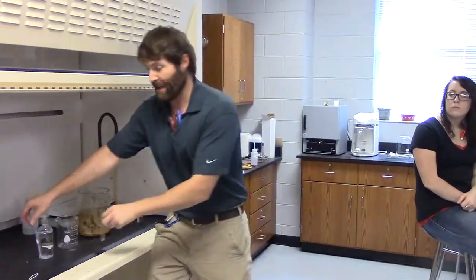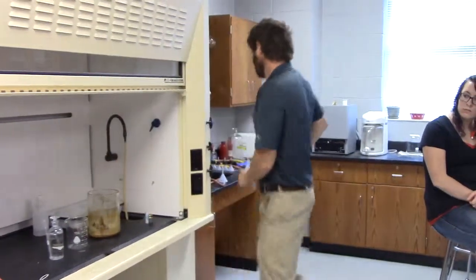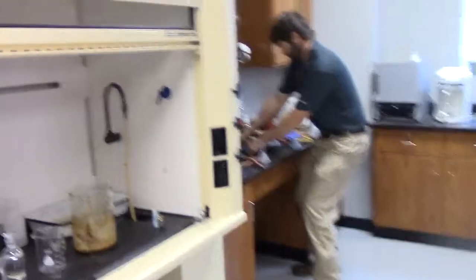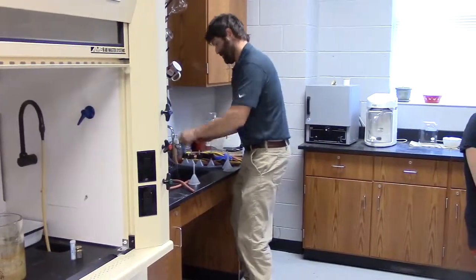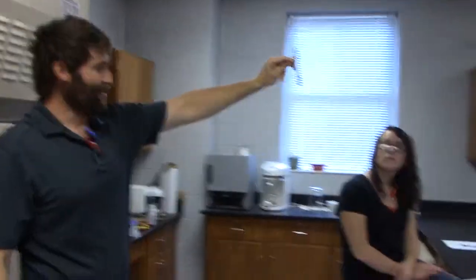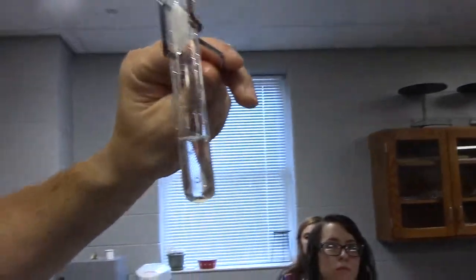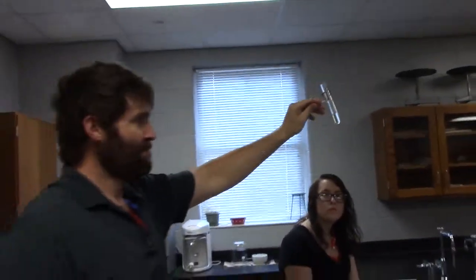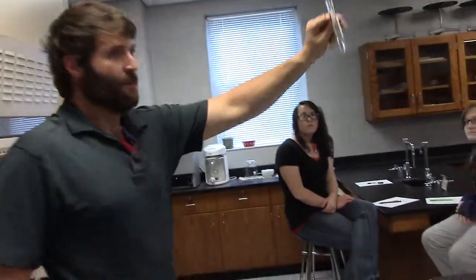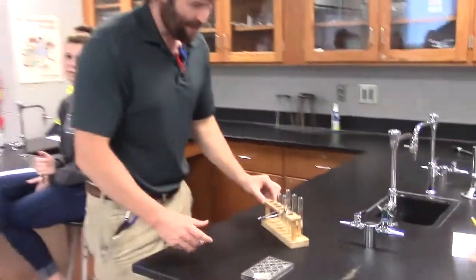So we're going to pretend I'm getting some HCl. Squirt, squirt. Notice my head's not under the hood. Video editing. Bam. And I've got my HCl. So do you see roughly how much I've got? About an inch worth in the bottom? It doesn't have to be a whole lot. Alright, come back over. So I've got my hydrochloric acid.